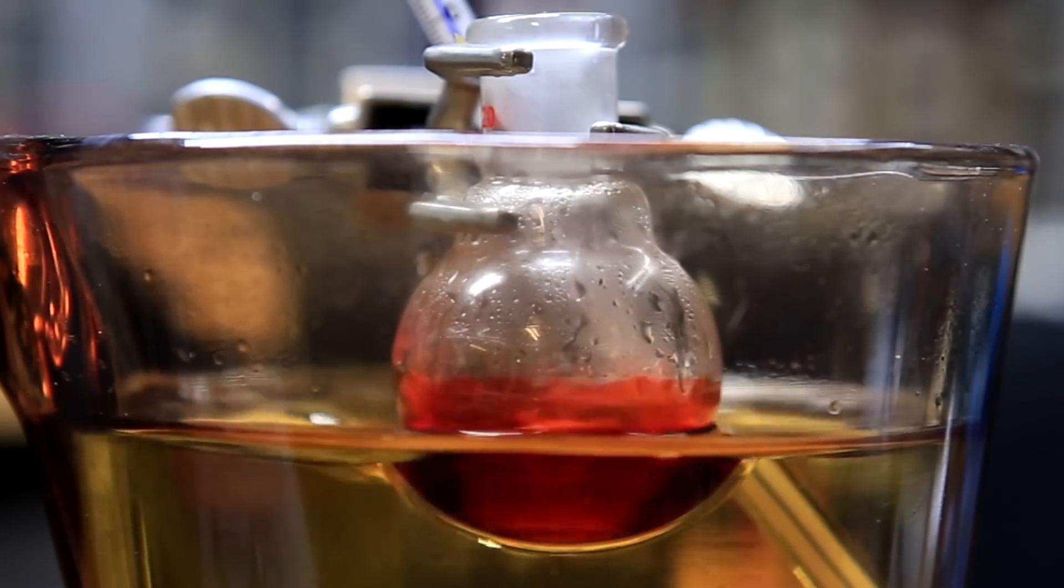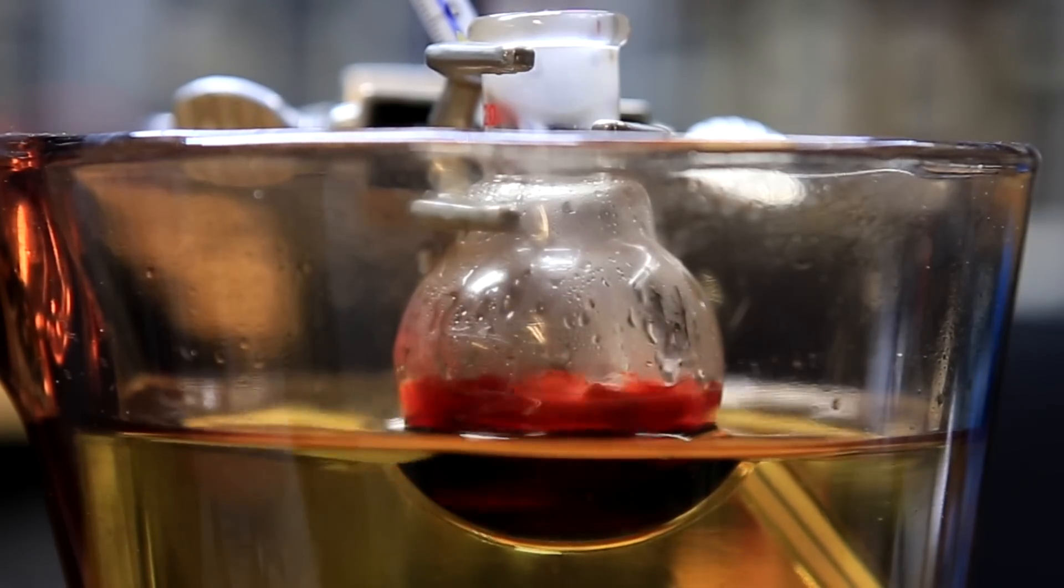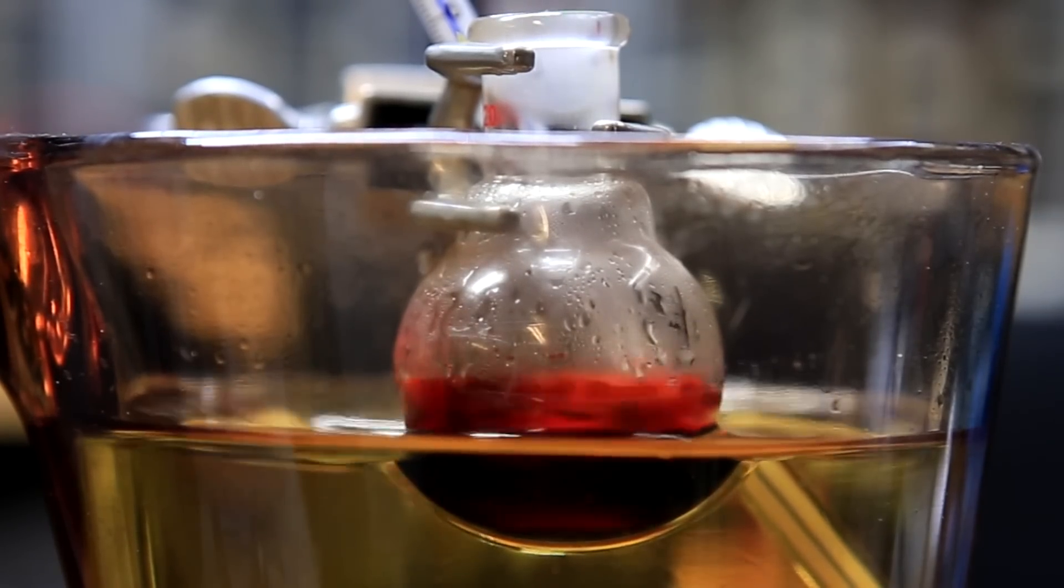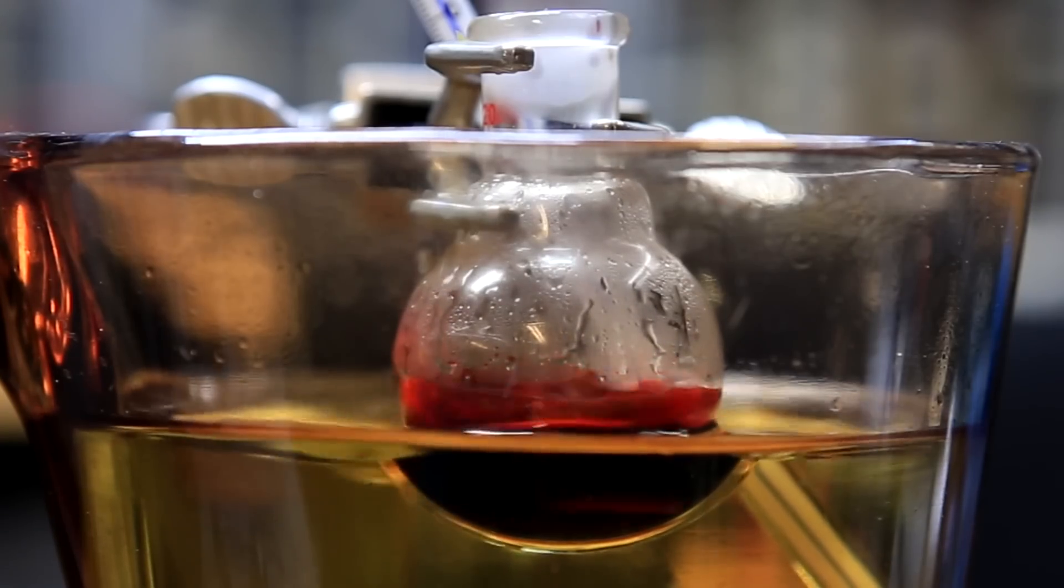As the reaction proceeds, it goes from a cloudy red to a clear red and then finally it turns nearly black. After 2 hours, the flask was removed from the oil bath and allowed to cool to room temperature.